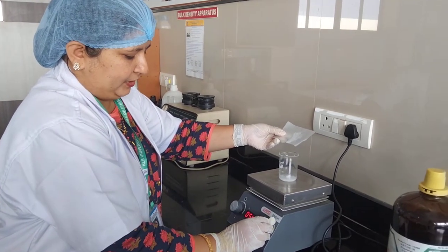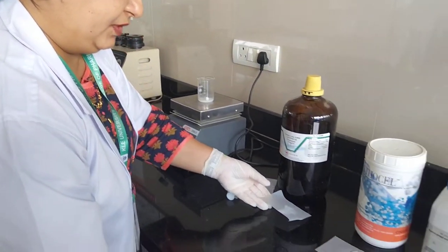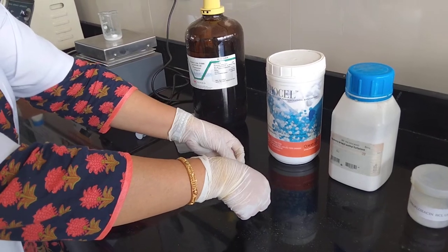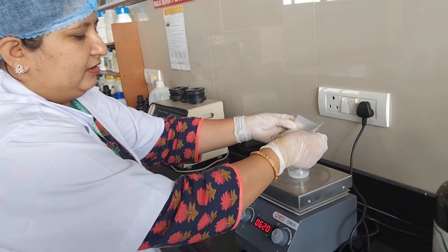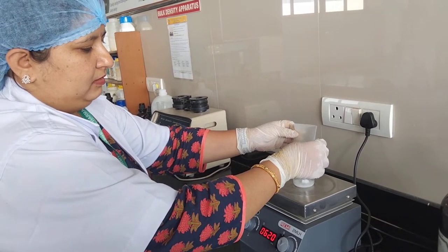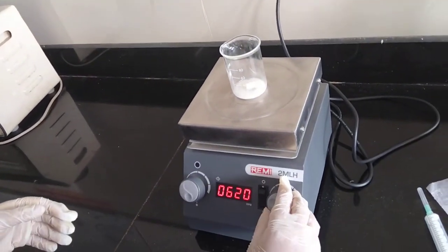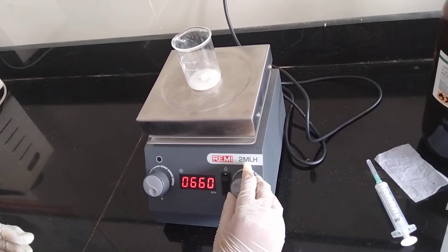We can also increase the speed up to 600 rotations per minute. The weighed quantity of ethyl cellulose, that is 50 mg, along with 50 mg of HPMC and 250 mg of the drug, will be added and dissolved in 20 ml of acetone.